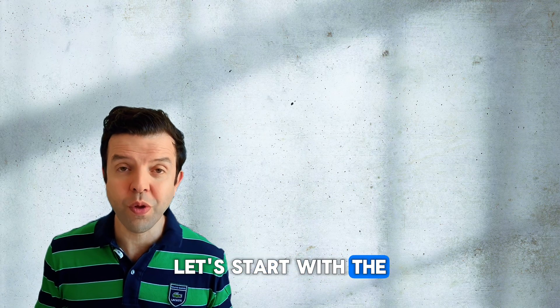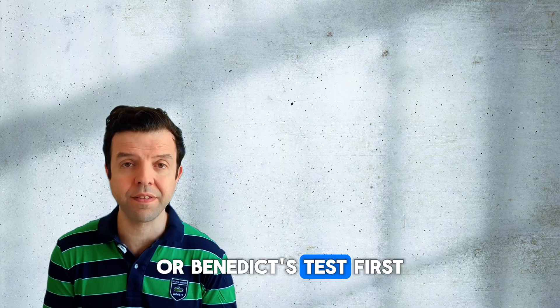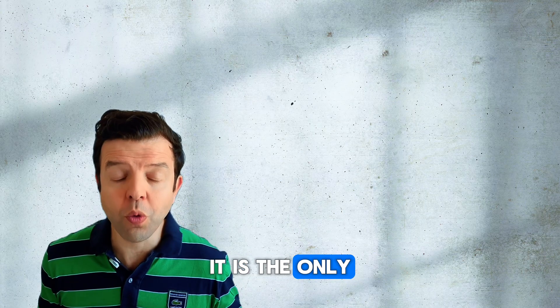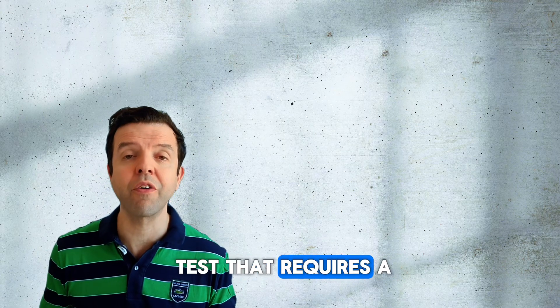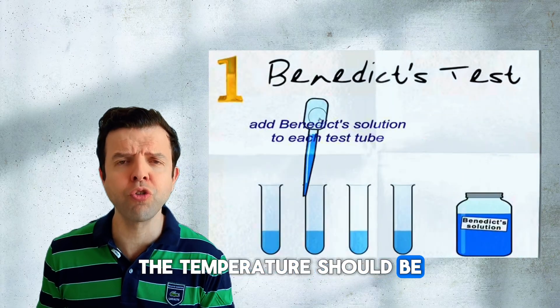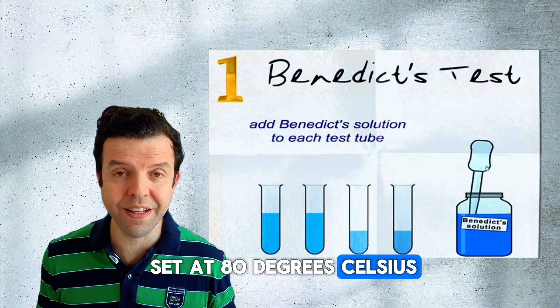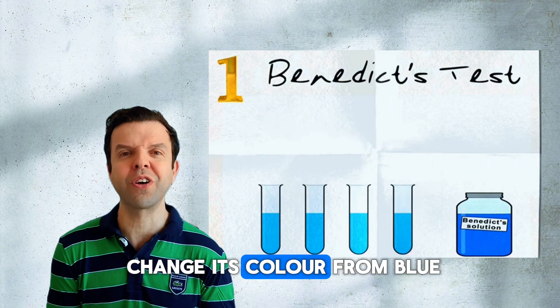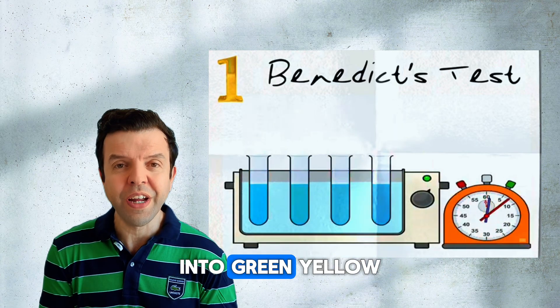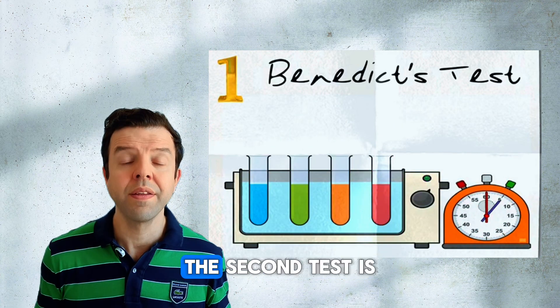Let's start with the test of reducing sugars, or Benedict's test. It is the only test that requires a hot water bath. The temperature should be set at 80 degrees Celsius, and the solution will change its color from blue into green, yellow, orange, or brick red.